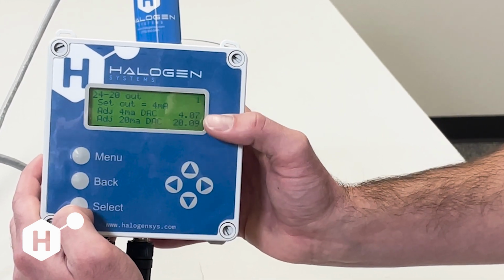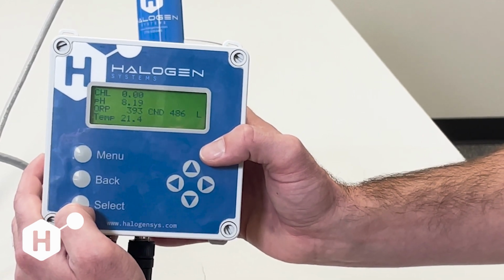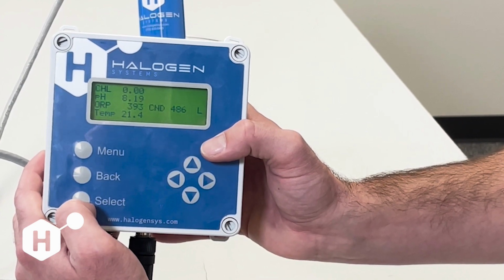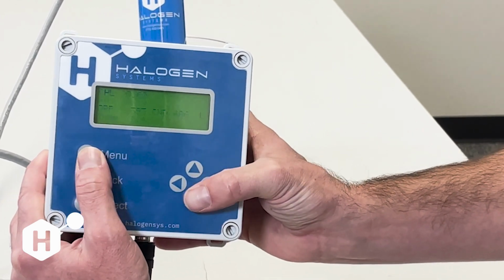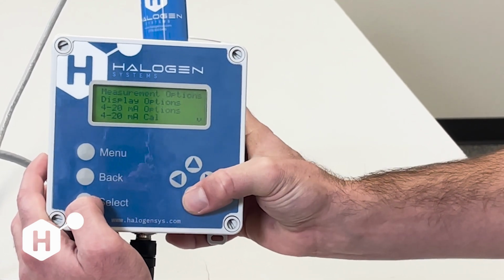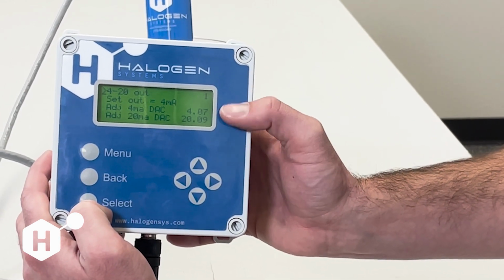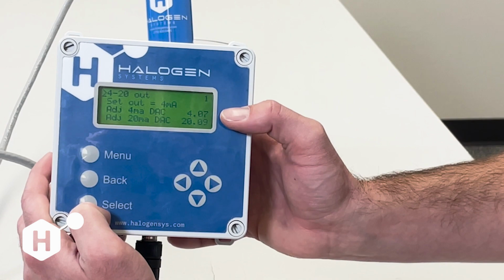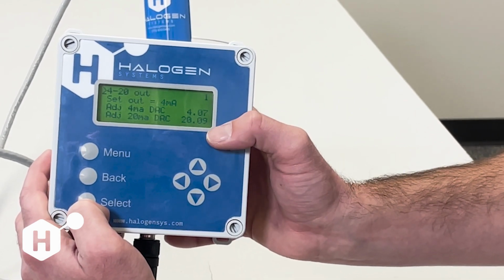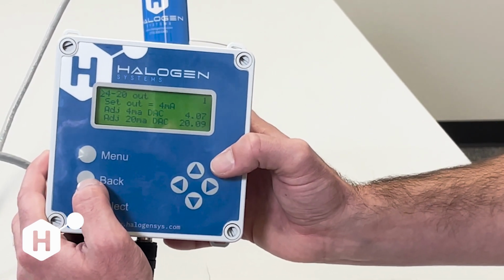If you're noticing that our display value is showing chlorine as 0.05, but your PLC is seeing it as 0.07, and you want to narrow that gap, you might need to use the 4 to 20 calibration to tighten that up a little bit. And you can also do that using a process clamp meter. However, I recommend doing it just looking at what your HMI is reading and then comparing that to our display and then adjusting these values until you're able to have them match.